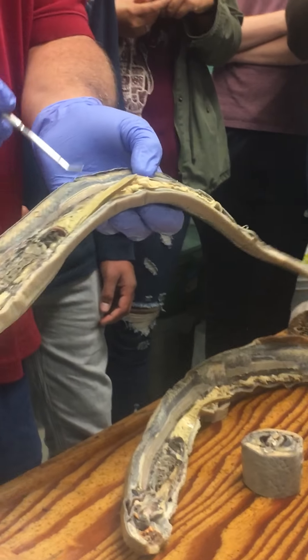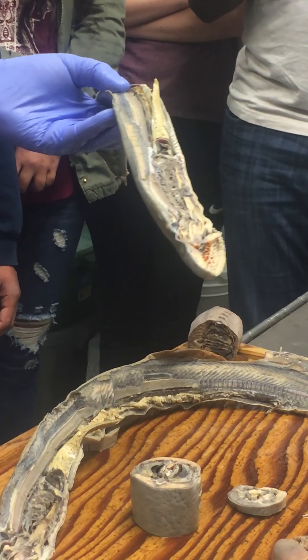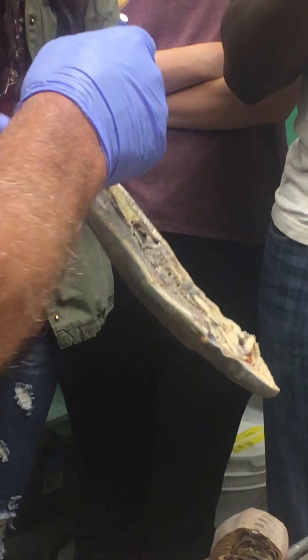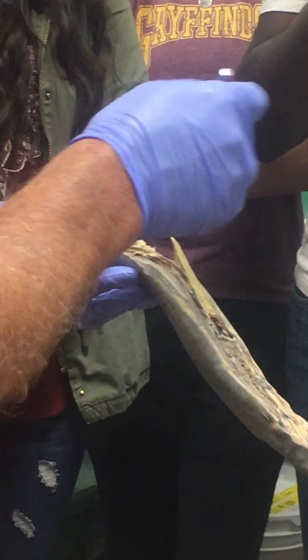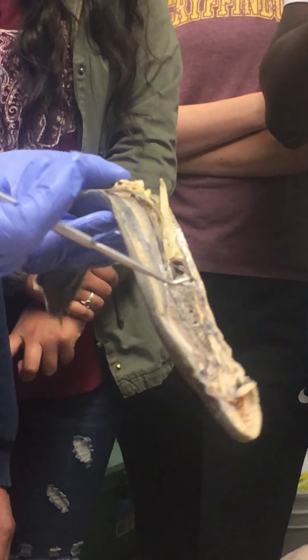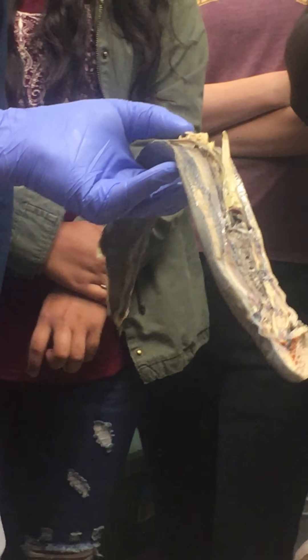The liver is usually a fairly large organ in the ventral body cavity. The pleural-peritoneal cavity is the fancy name for the body cavity here — in mammals the pleural cavity is the lung cavity and the peritoneal cavity is the gut cavity, but since lampreys don't have lungs they just have one big cavity, which we call the pleural-peritoneal cavity.